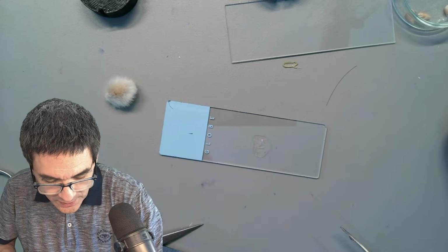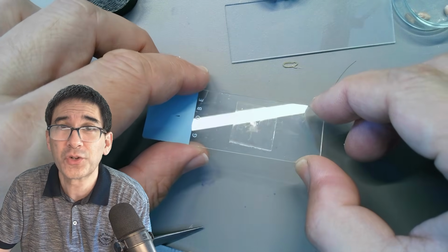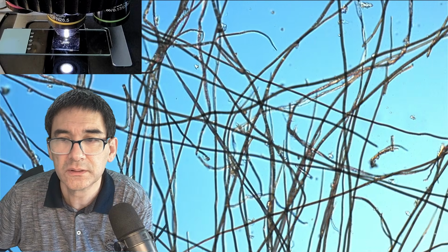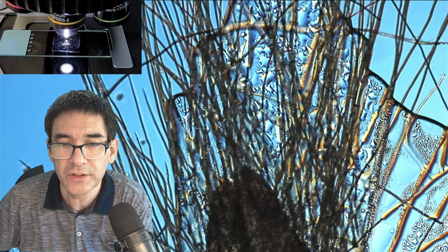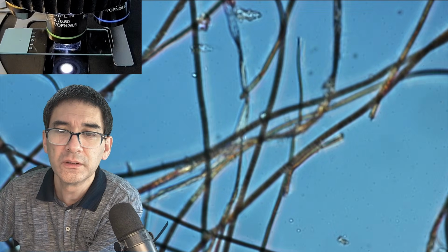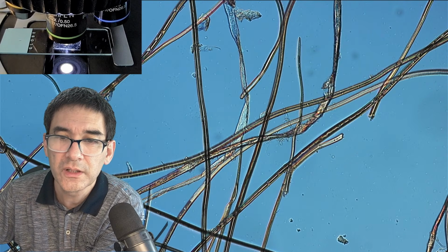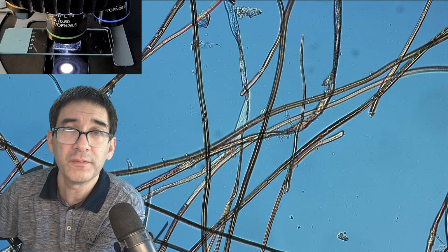Cover glass goes on top as always. Here we go. And it goes under the microscope. Okay, here it is. This is how it looks like. And of course, a lot of air is caught here as well. Well, it's still very thin, and up with the magnification here. Now we're also able to see that there seems to be a little bit of structure present as well. Let's still go up with the magnification.